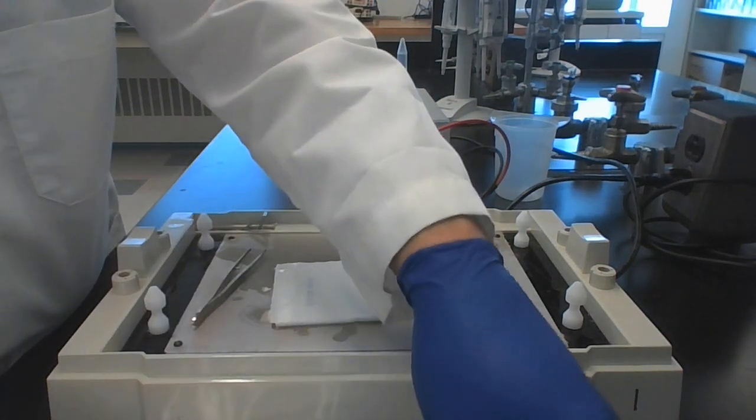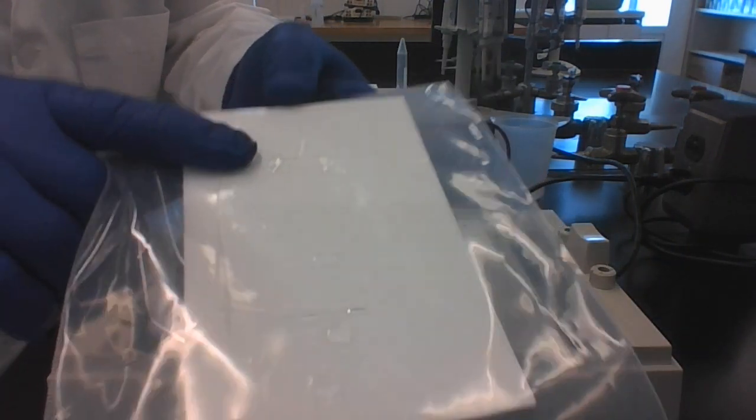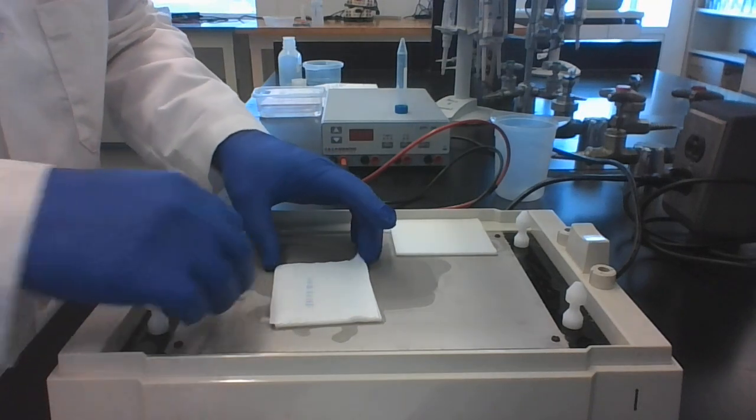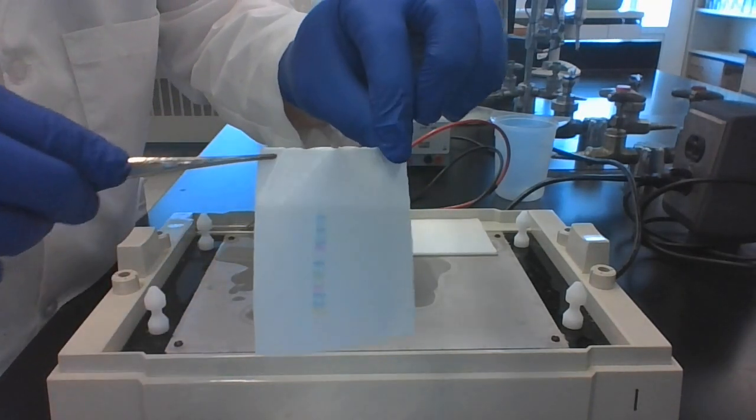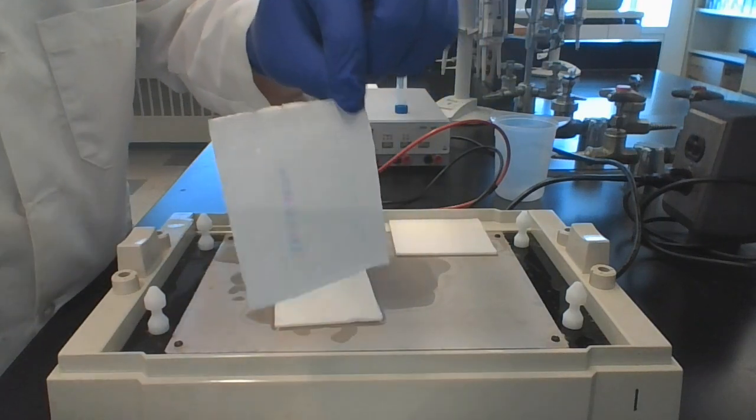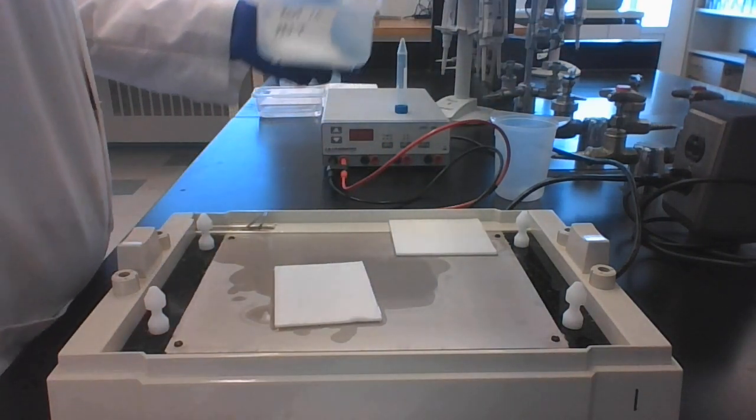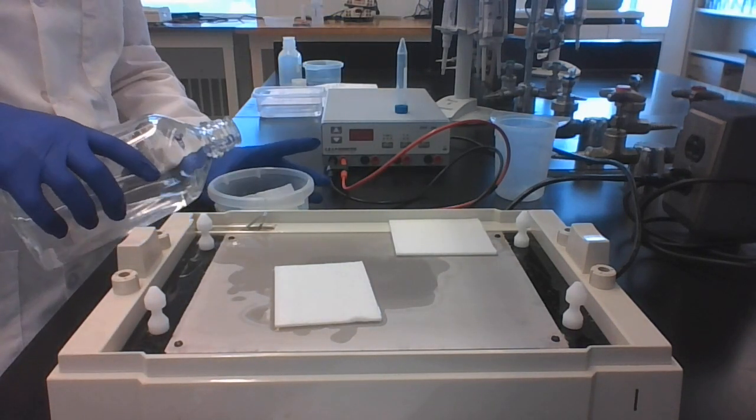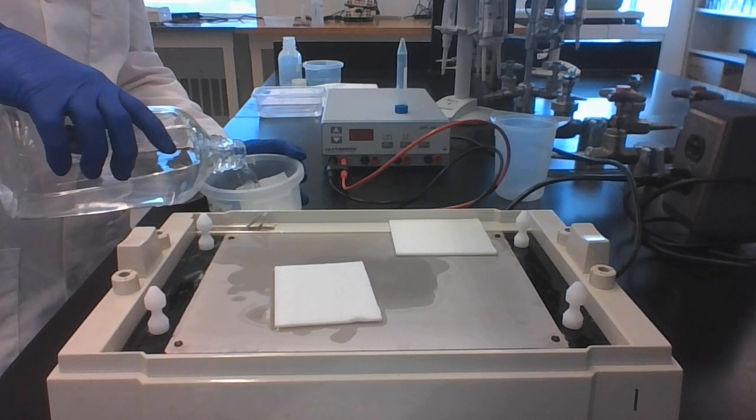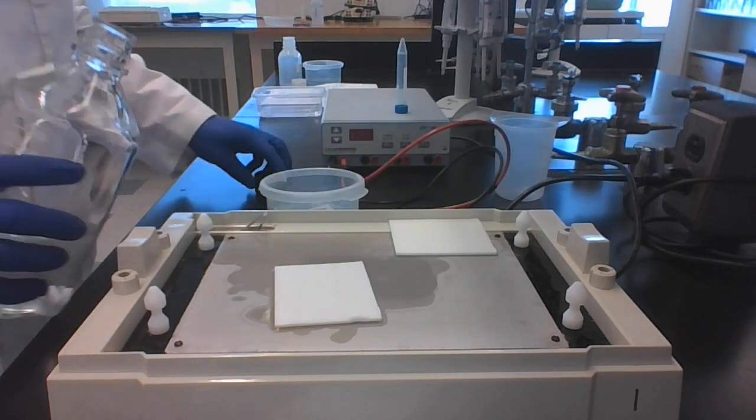The gel no longer has any bands from the ladder in it. However, when we look at our membrane, the ladder has been transferred to the membrane. We simply place this into another container with PBST in it and we save it until we're ready to do the next step.